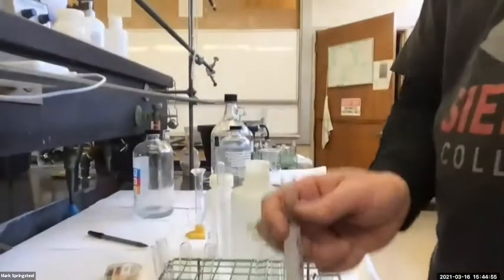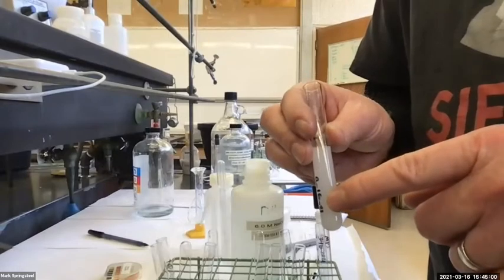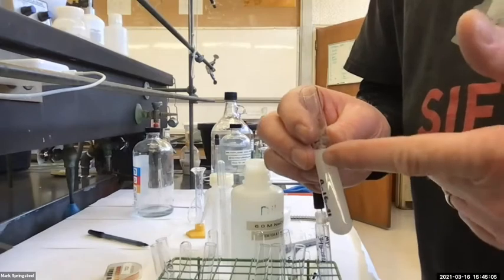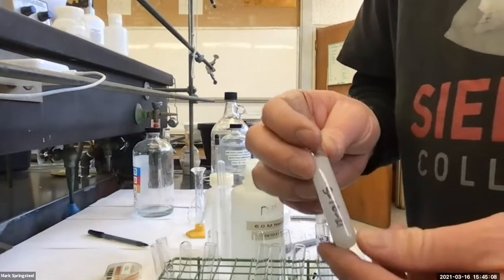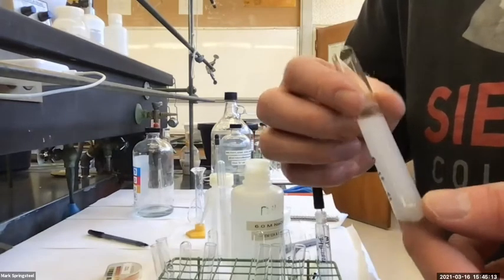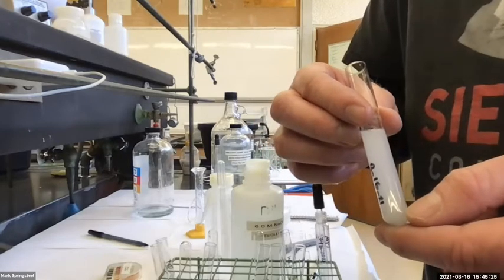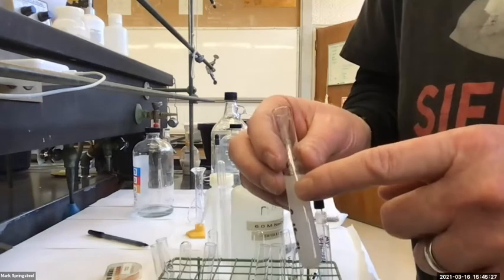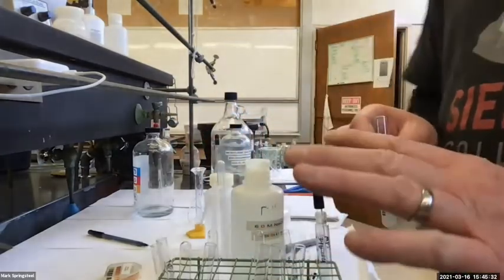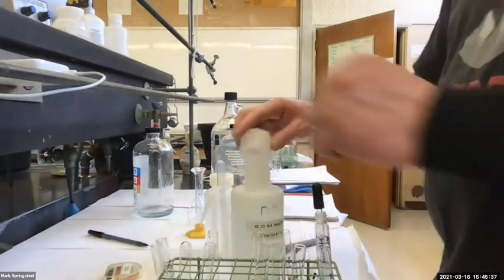This one, if you remember, I was talking about the way to get this kind of a product out of the aqueous layer. There's two ways: you could filter it through filter paper, or you can extract it with the organic solvent, like fresh methylene chloride. When you look at this, it's pretty fine particles, huh? Do you think I would want to filter this or extract with methylene chloride? Extract. Yeah, if I try to filter this through filter paper, it's going to be such a fine particle. Some of it will get around the filter paper or just be caught in the filter paper. So I'm going to probably be extracting that, not filtering it.